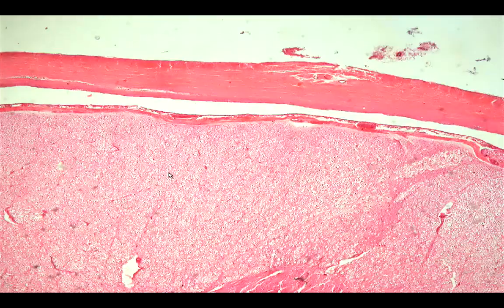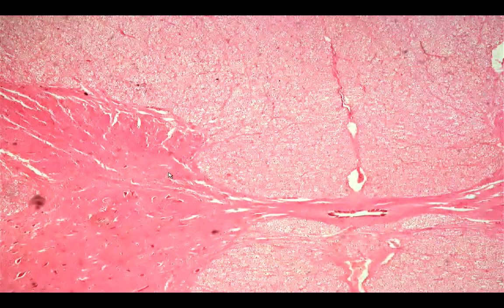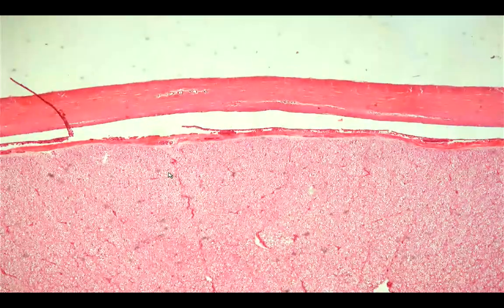So for the spinal cord, let's move it around so that you would appreciate it. So this is a big tissue. Okay, so let's start. The outer surface of the spinal cord, we have this connective tissue that would surround the spinal cord, which we would call the meninges.